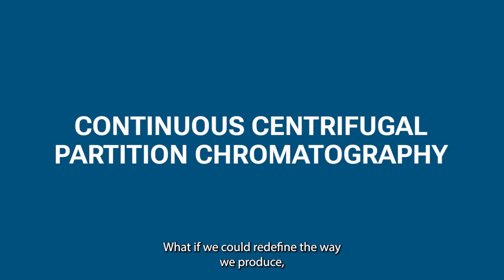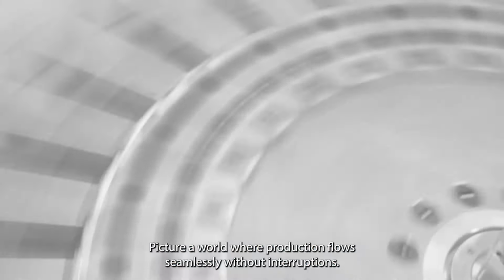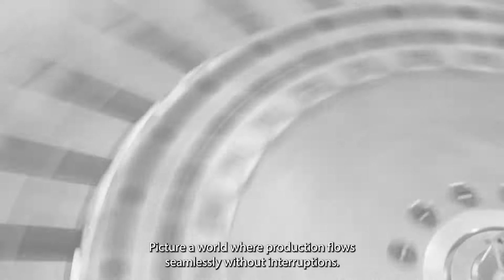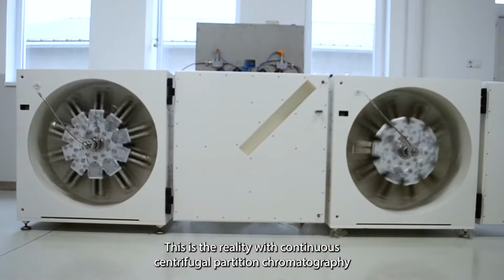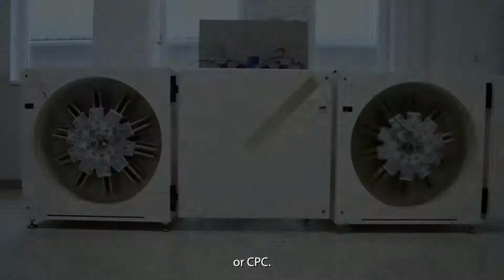What if we could redefine the way we produce, making it more efficient, cost-effective, and sustainable? Picture a world where production flows seamlessly, without interruptions. This is the reality with continuous centrifugal partition chromatography, or CPC.